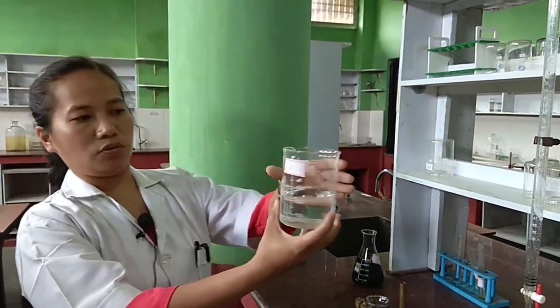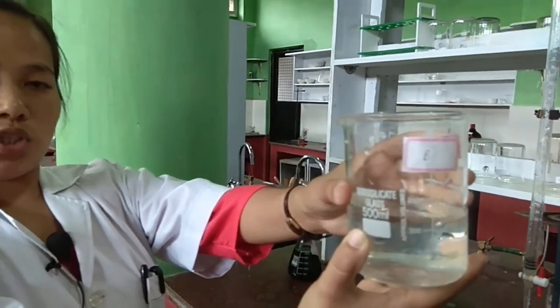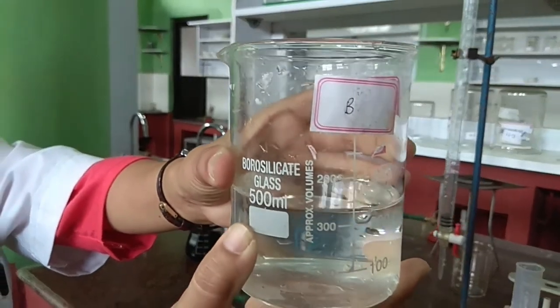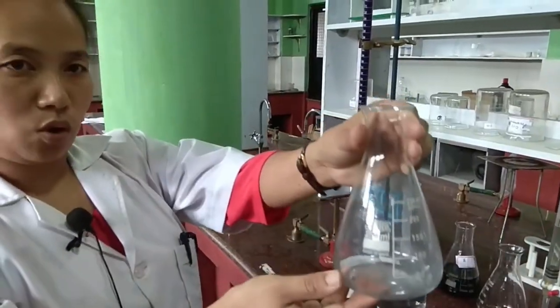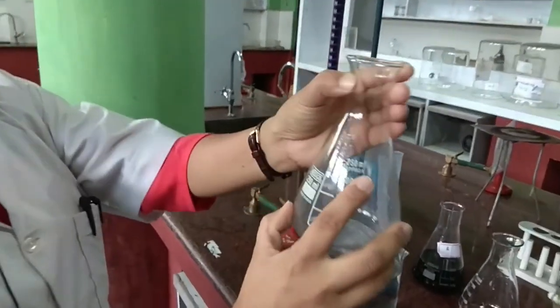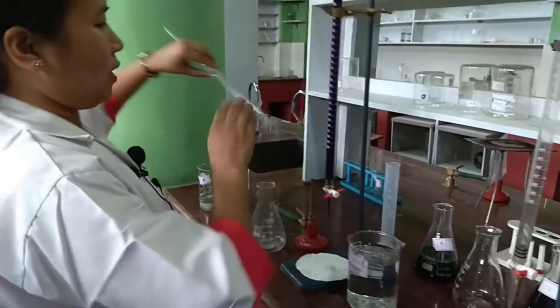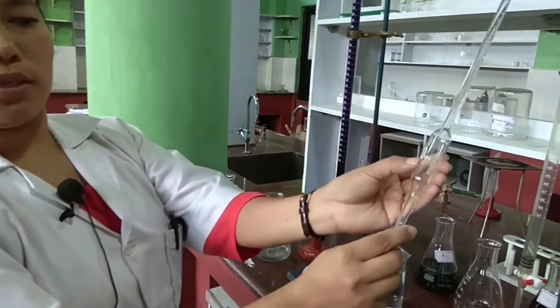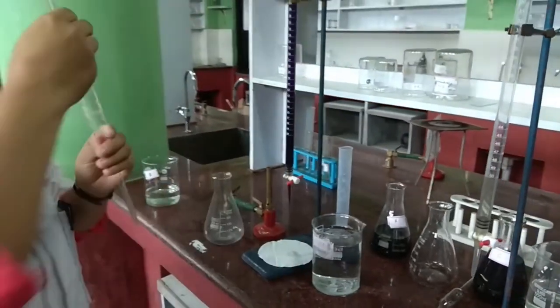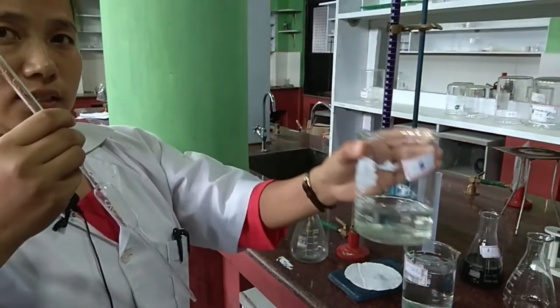This is the solution of hydrated ammonium iron 2 sulfate crystals, which contains 19.8 grams in 1 litre. Take this 250 ml conical flask and a pipette whose capacity is 20 ml. With the help of this pipette, pipette out the hydrated ammonium iron 2 sulfate solution.